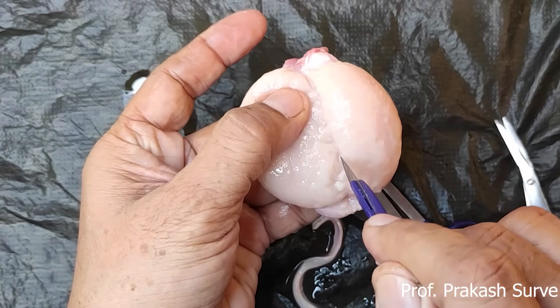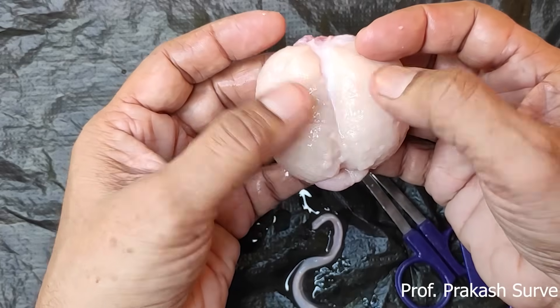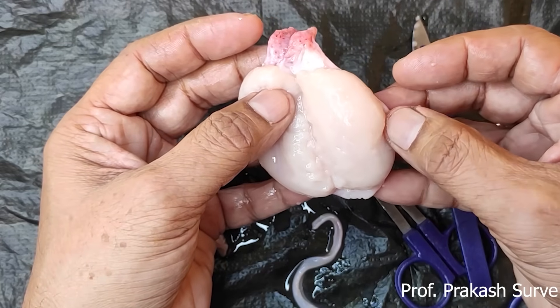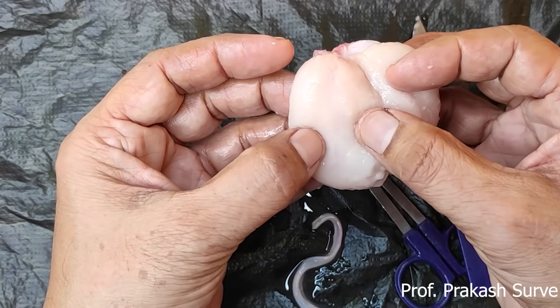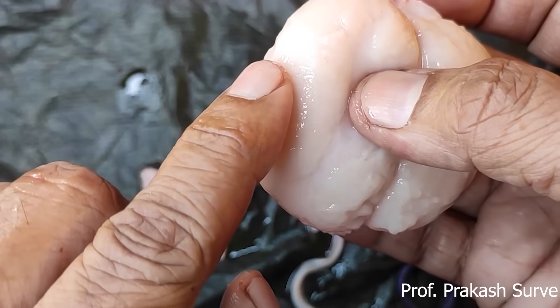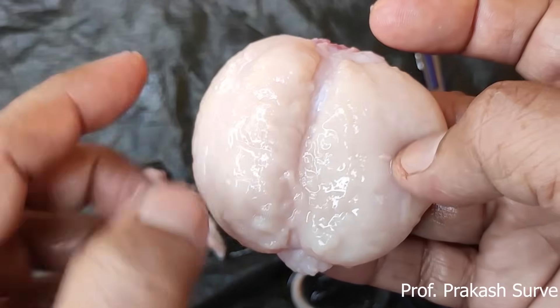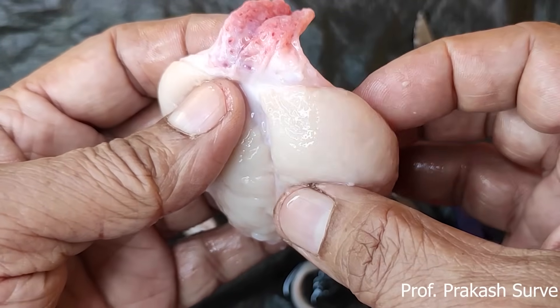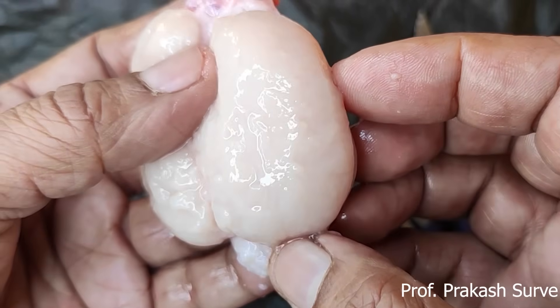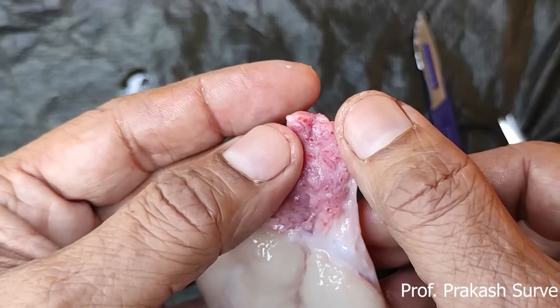The function of the testes is the production of the sperm, as well as it produces the male hormone called testosterone. If you observe here, many testicular lobules are present, and inside those are many seminiferous tubules. For observing this in detail, we need a stain — if we stain it, then we can get a clearer idea. The function of these seminiferous tubules is to produce the sperm. About the spermatic cord, where we can observe many vessels.